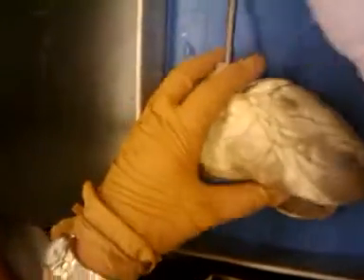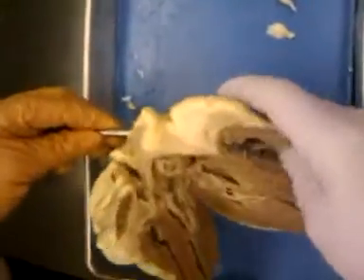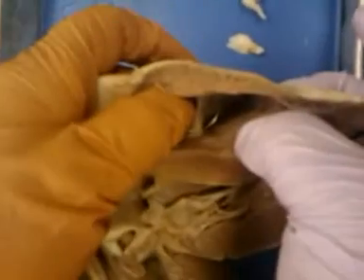Okay. Again, looking at the vessels from the pulmonary trunk here, we expect this to be in the right ventricle, so let's follow it, see if it comes into the right ventricle. It is difficult to see the pulmonary semilunar valve, but there is the probe into the right ventricle.